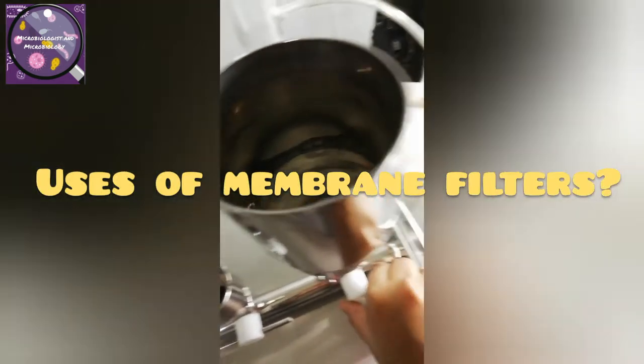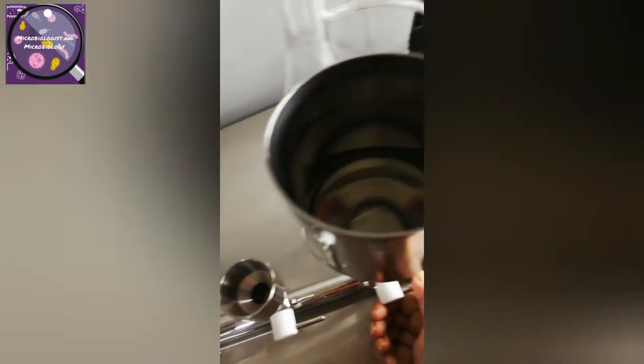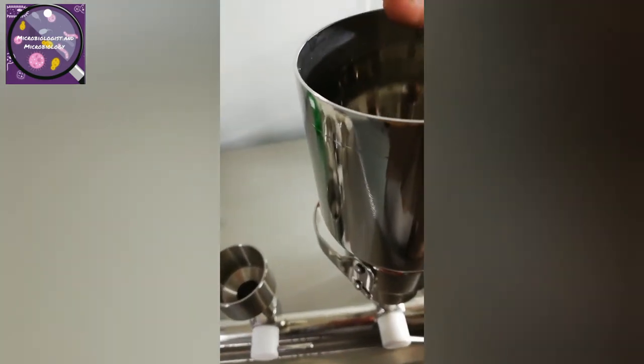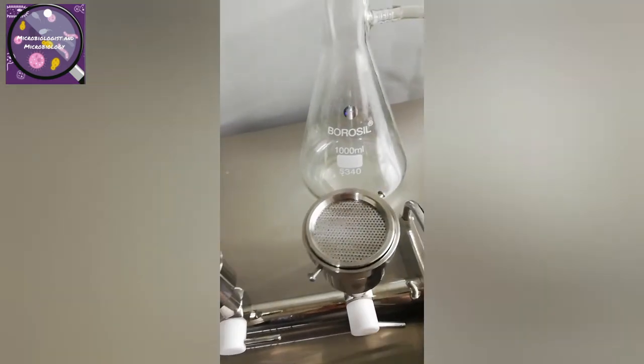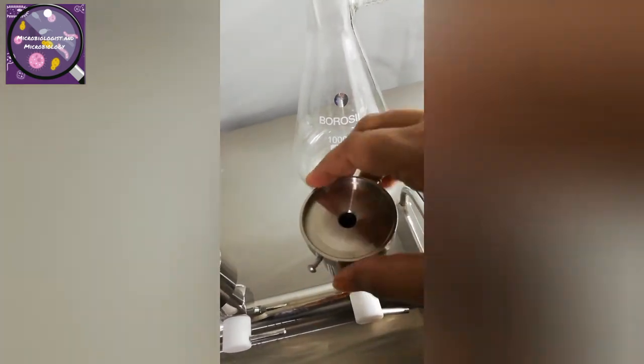The uses of membrane filters: membrane filters are used extensively in the laboratory and in the industry to sterilize heat-labile fluid materials. They are an effective and acceptable technique to monitor drinking water, especially useful for bacterial monitoring in the pharmaceutical, cosmetics, electronics, and food and beverages industries. They also allow the removal of bacteriostatic or bactericidal agents that would not be removed in pour plate, spread plate, or MPN techniques.